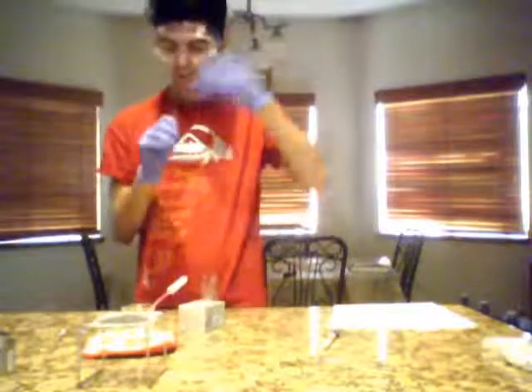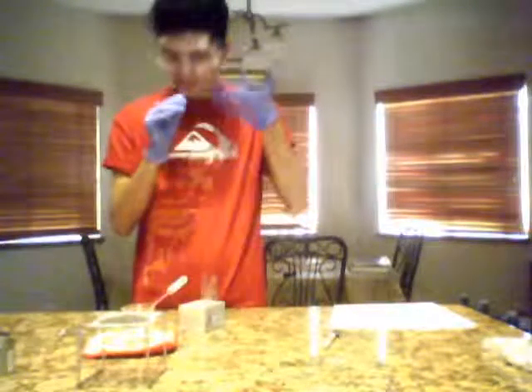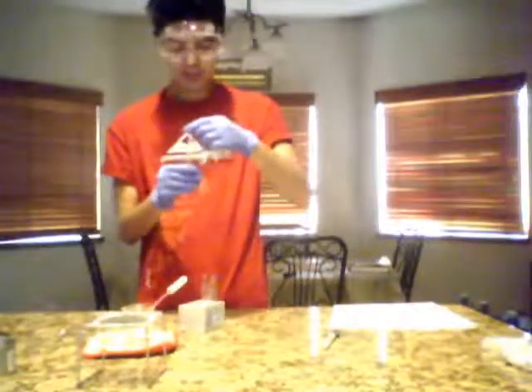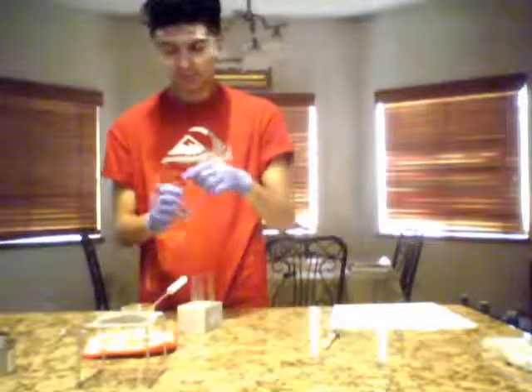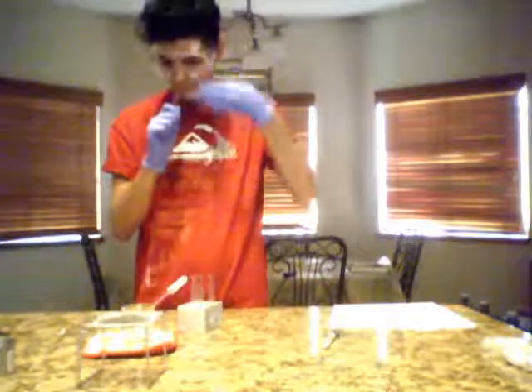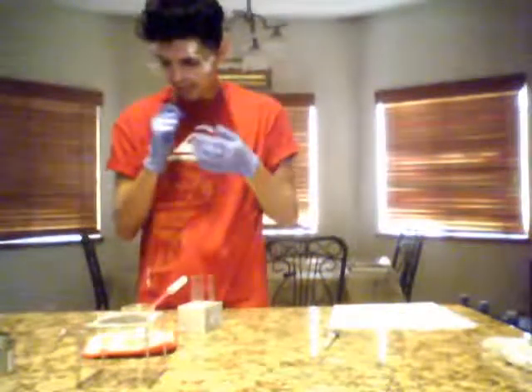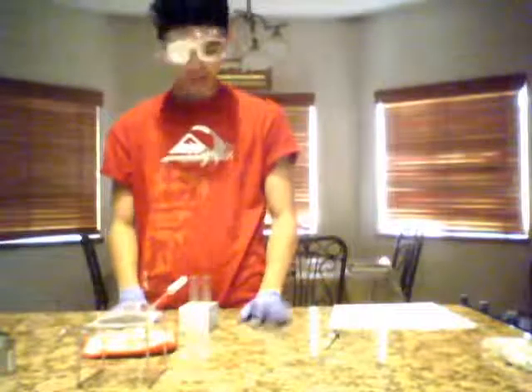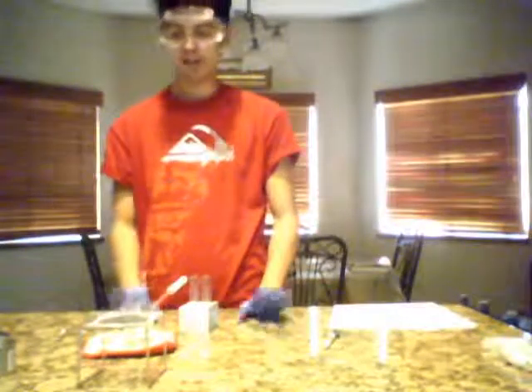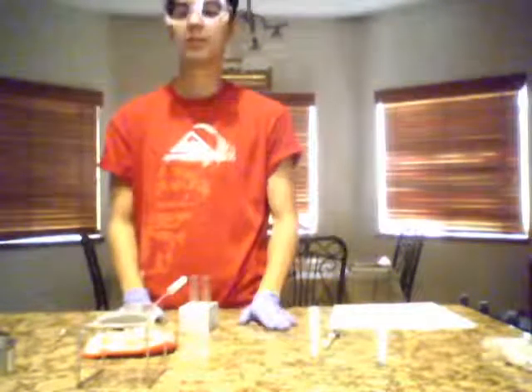Number 6, it's also sweet. I would describe this as smelling like licorice, like the Red Vines ones. And number 7 is my favorite because it smells like mint, like peppermint, like wintergreen, and that's what I would say it smells like. Okay, so that does it for the end of synthesis of fragrant esters part 2. Thank you.